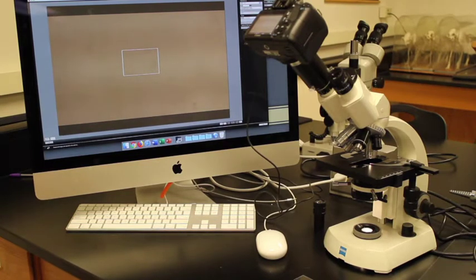The goal of this week's lab is to examine cells. We're going to use the microscope to examine cells. We'll be looking at various microscopic techniques to examine a variety of different cells.